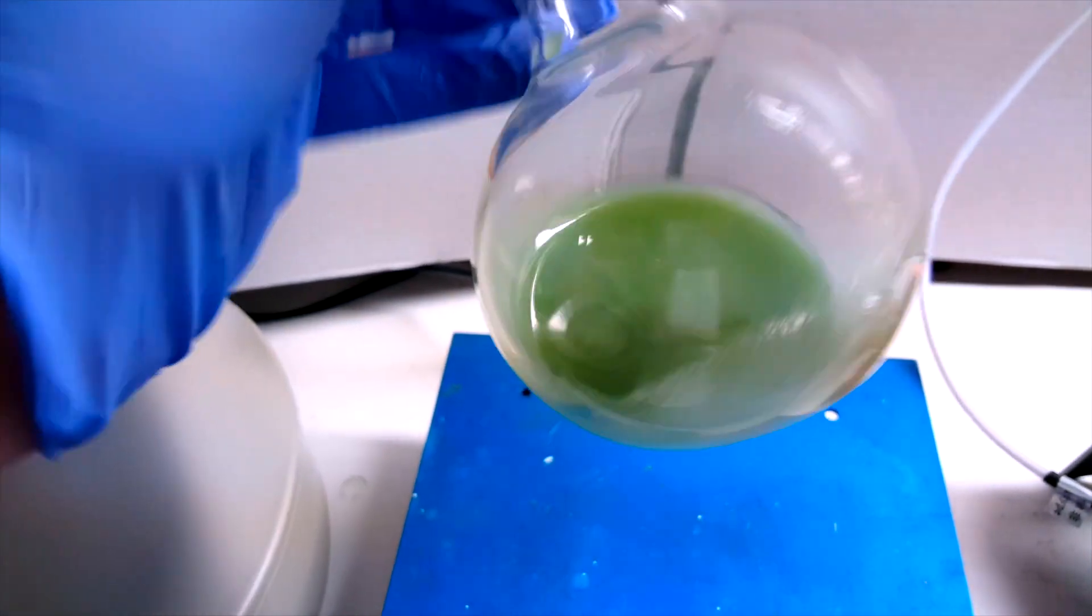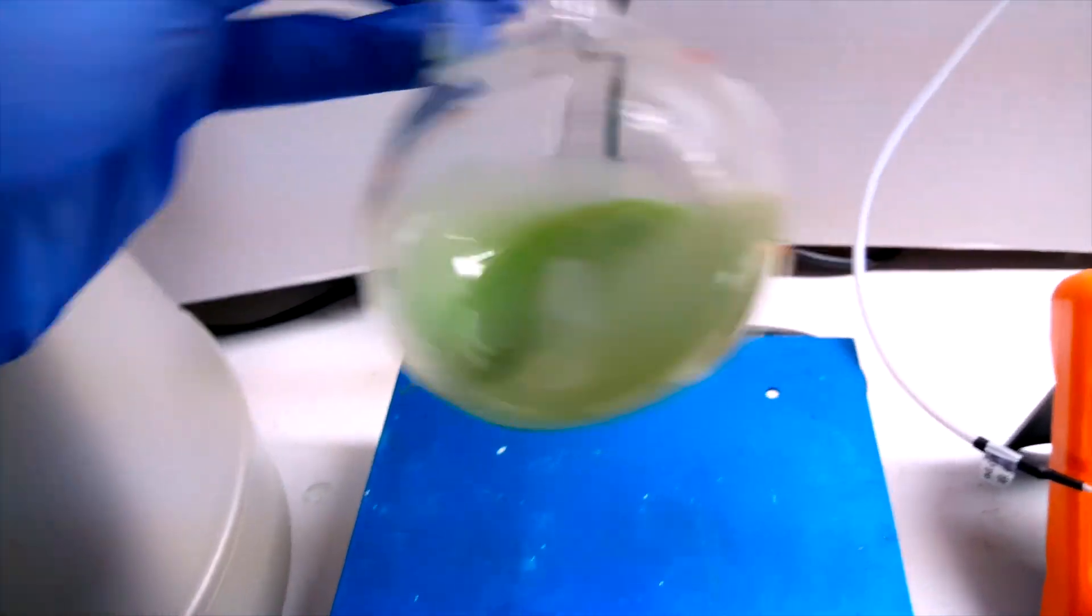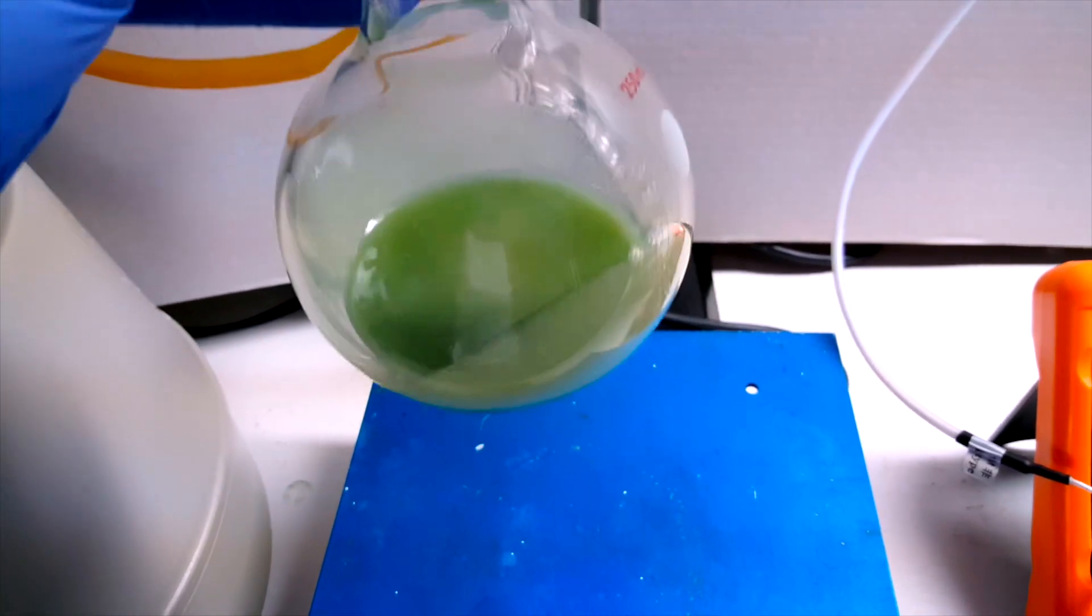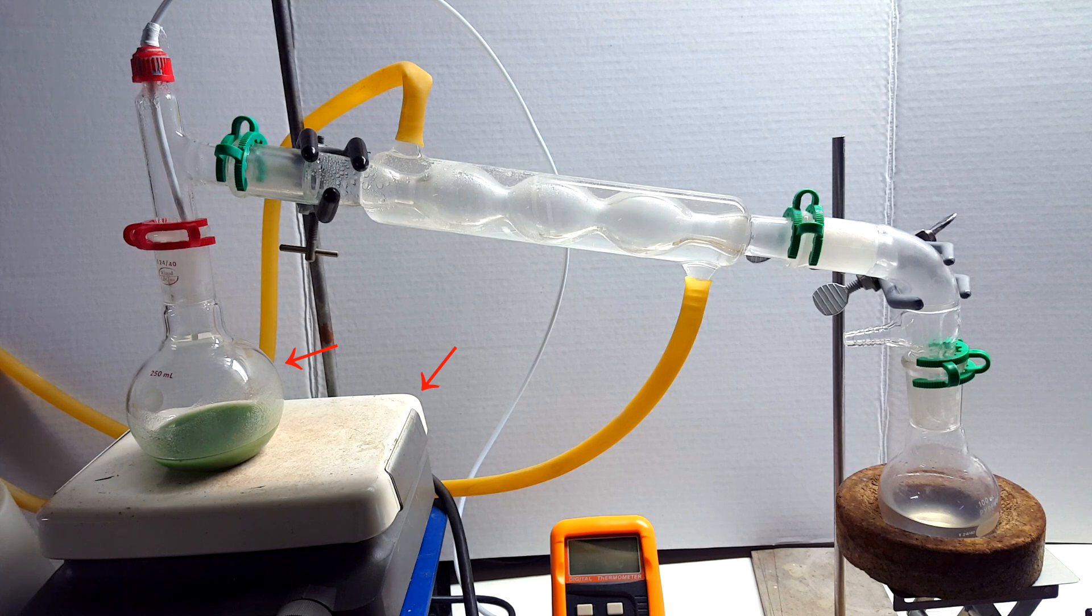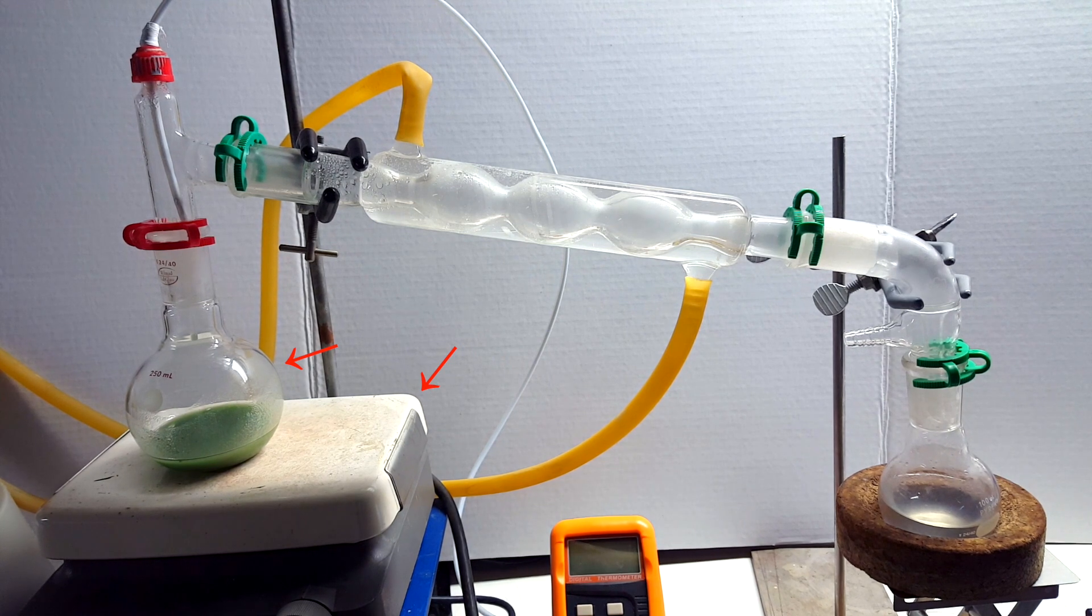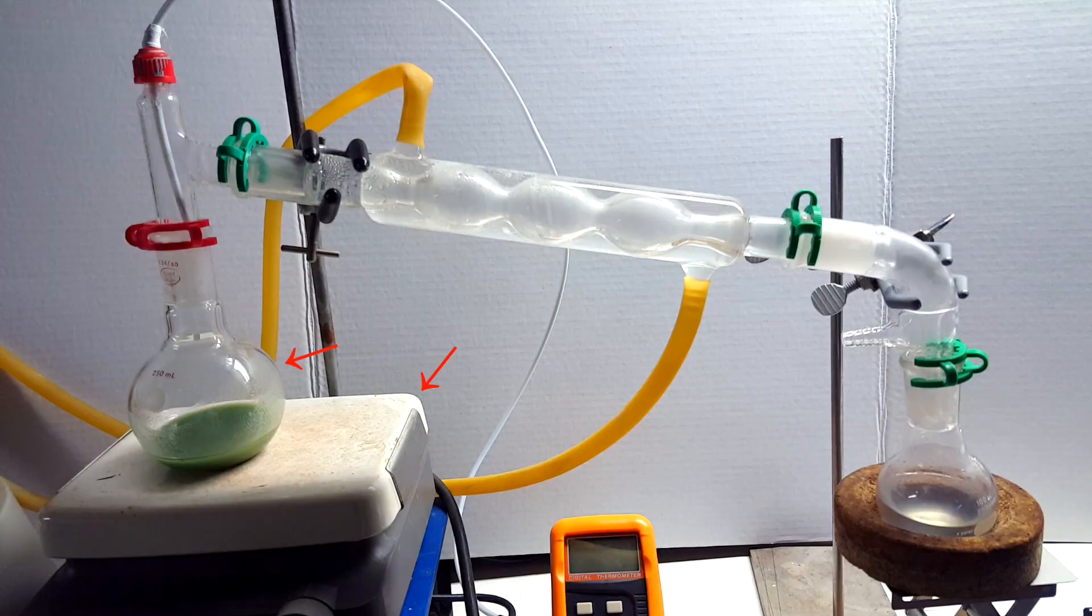The normal green color returned, and you can see that it is a nice, viscous liquid characteristic of phosphoric acid. This is what the setup looked like after being put together. The only changes from the previous setup are the smaller, flat bottom flask, and the hot plate added on the left.